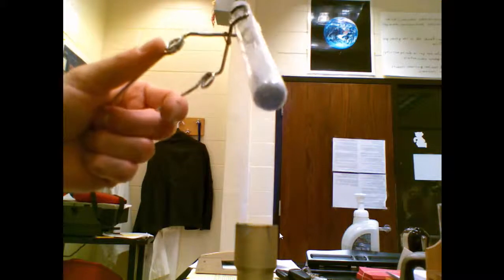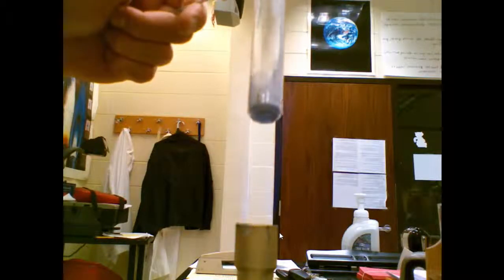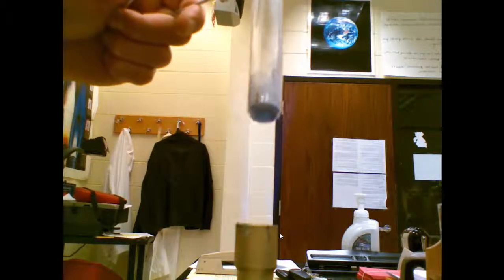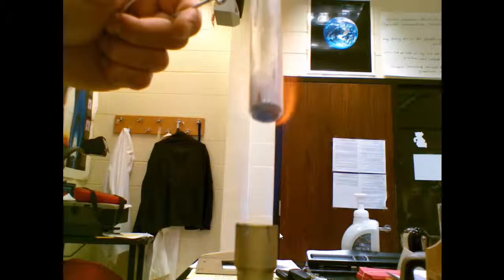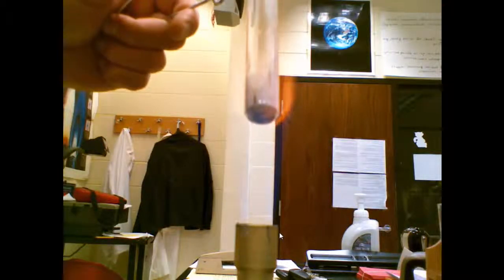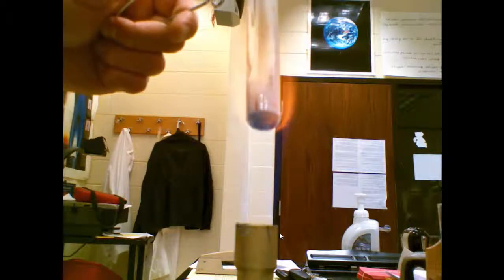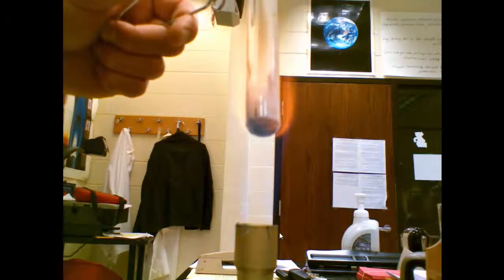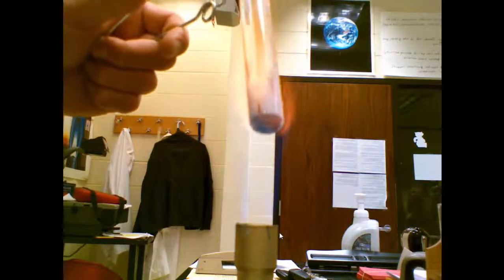Crystal number seven, fine grayish powder. It has not started to melt. Flame is starting to get a hint of yellow. Okay, there's the yellow. No melting. Still no melting. We have a yellow flame and I have not been able to melt the sample.